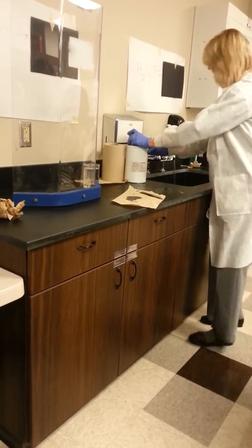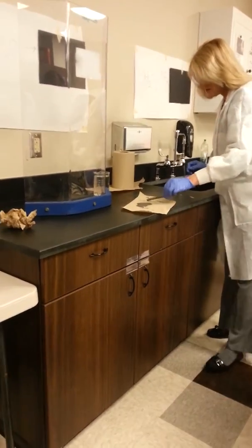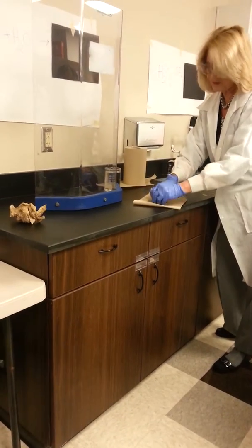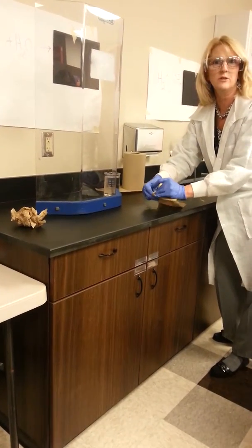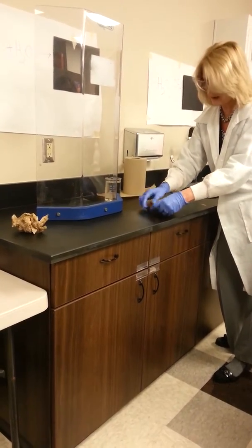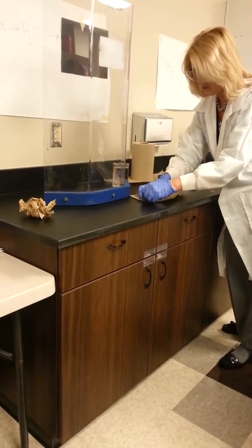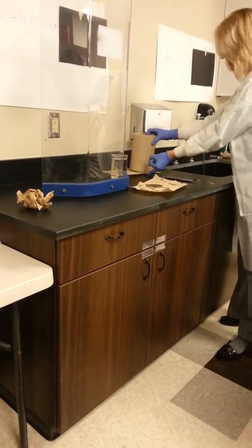Okay, we're going to put the rest of that back safely and out of the way. And I'm going to take this piece of sodium, and I'm going to attempt to remove the oil now so that we can get it to react. The more oil I'm able to squeeze out of it, the more reactive it's going to be. Also notice as I'm doing this, I'm forming it into a ball. It's very, very clay-like.